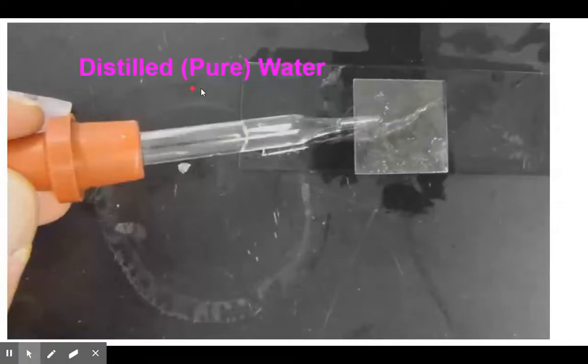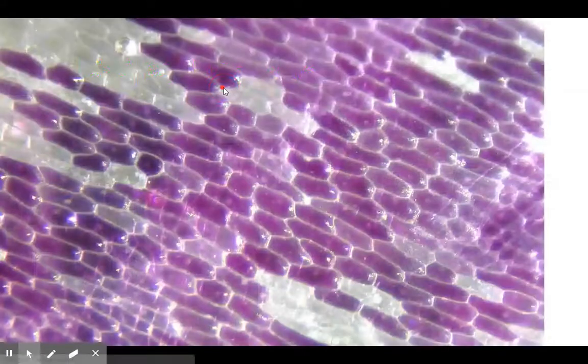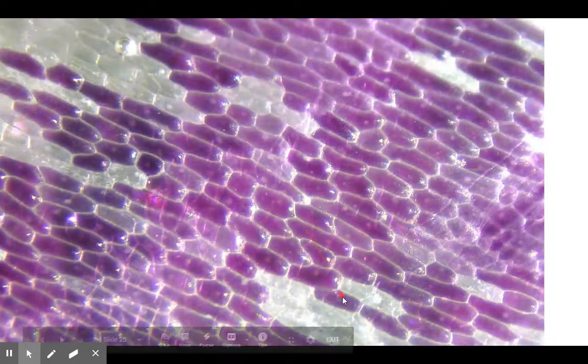Distilled water is, in other words, pure water. It has no dissolved substances in it. And if we look at it under the microscope we see something amazing.